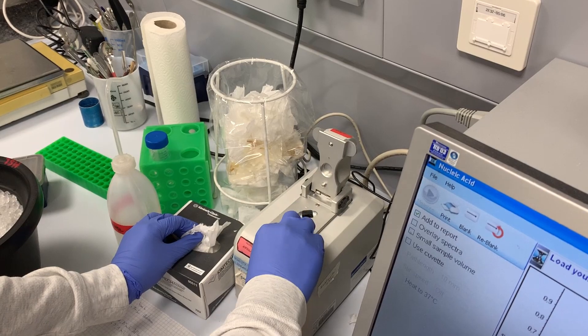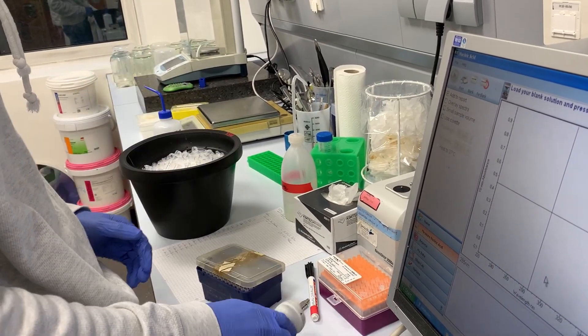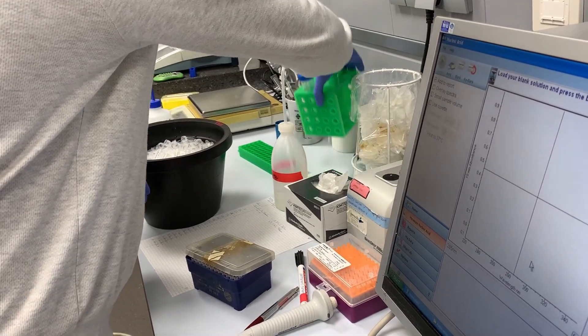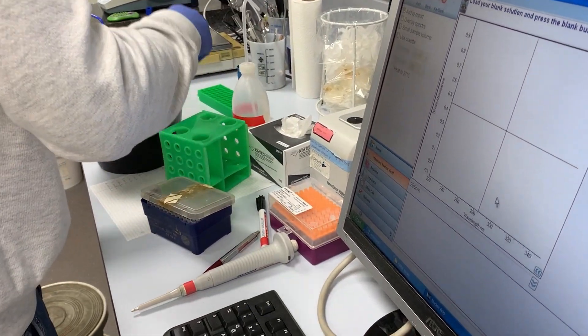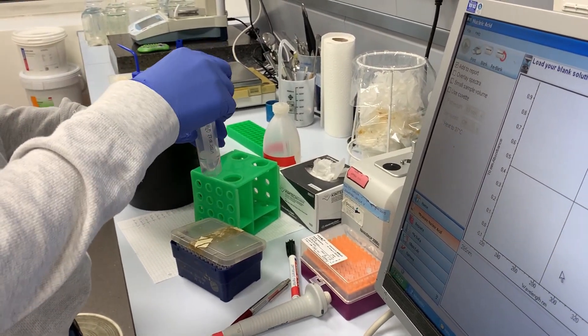Once you have achieved that, you are ready to blank. You use any solution that you use to purify your DNA or any solution that your DNA is suspended in. Because this is a demonstration, we used water.